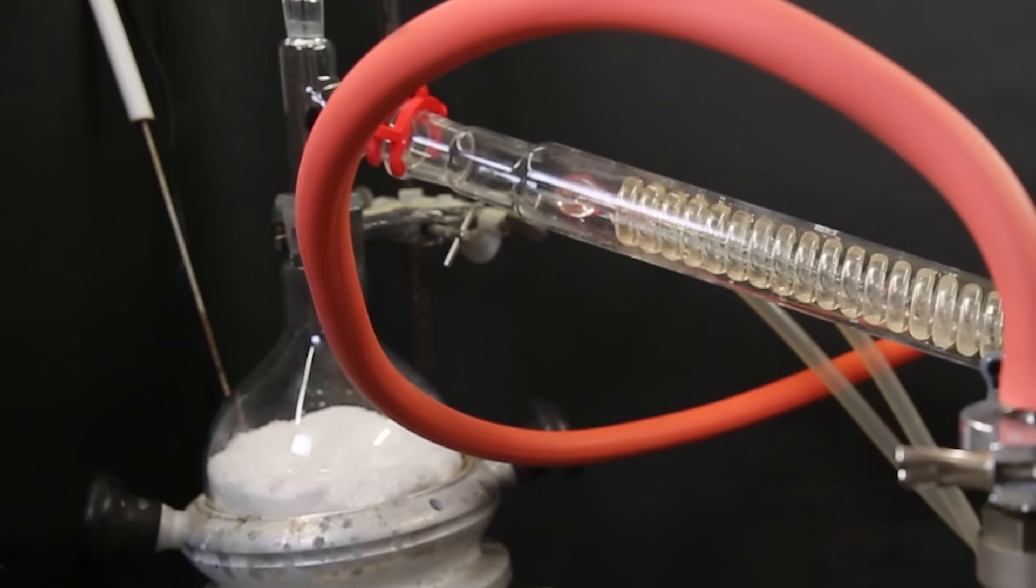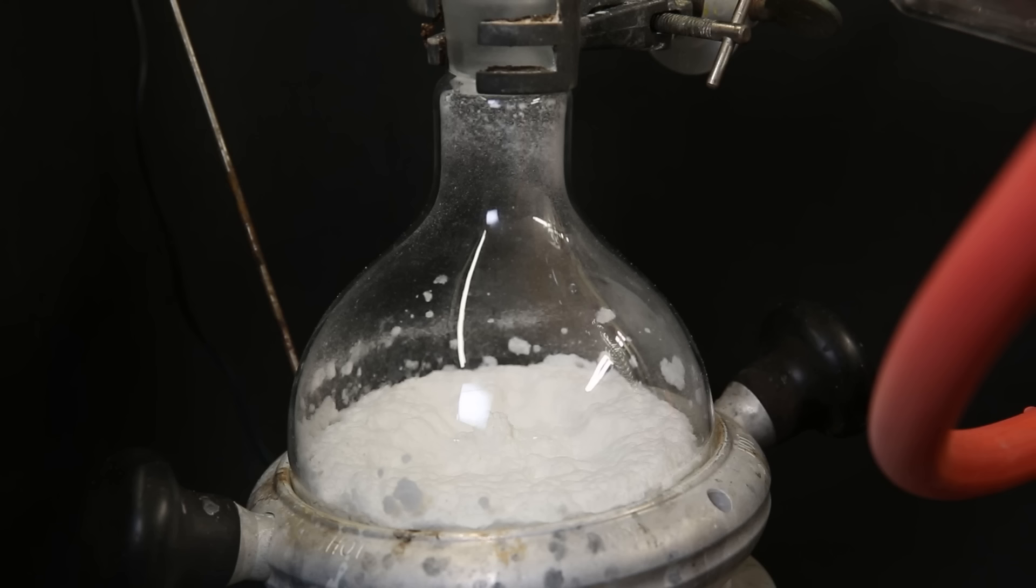Except, okay, I guess not. So my powder is a bit loose to be doing it like this. So I cleaned up the mess and started heating the flask a bit before I pull the vacuum.